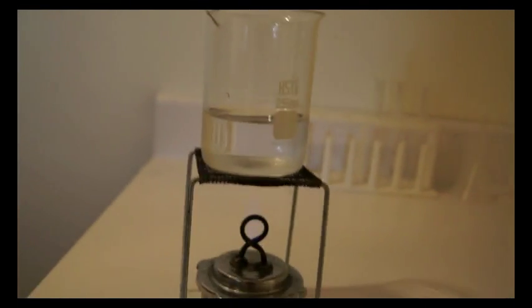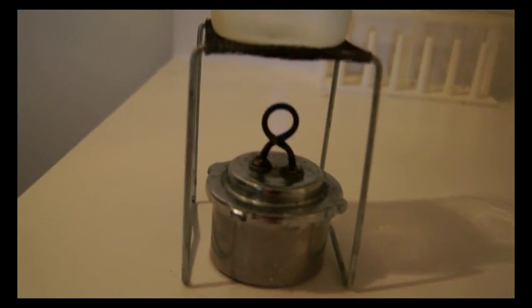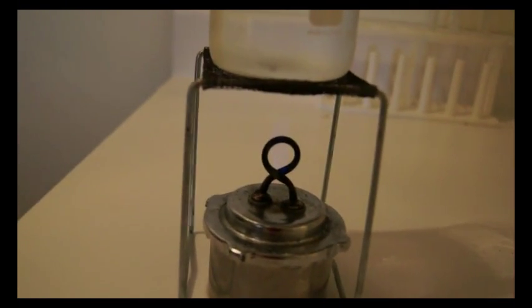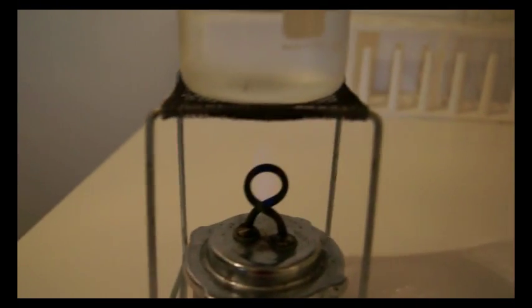Now, it would be much better if I had a hot plate, but I'm actually getting one soon. Right now I currently do not have a hot plate.